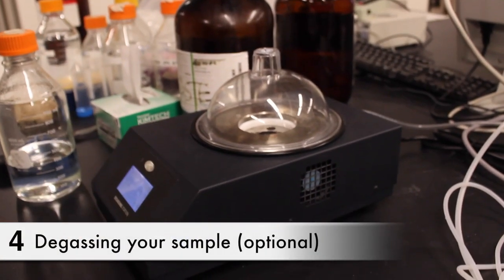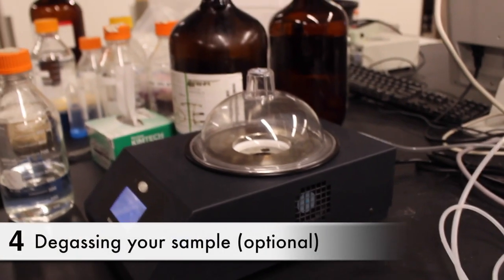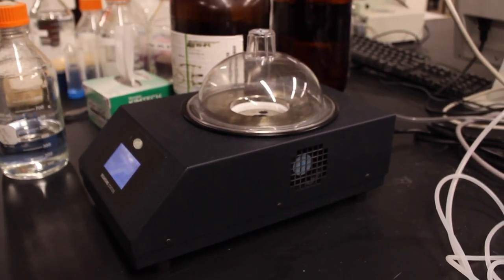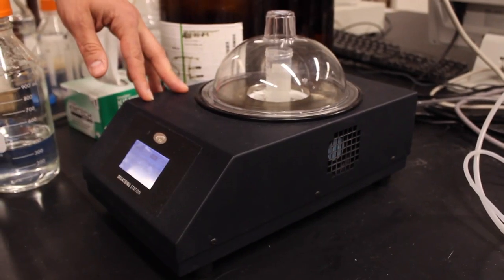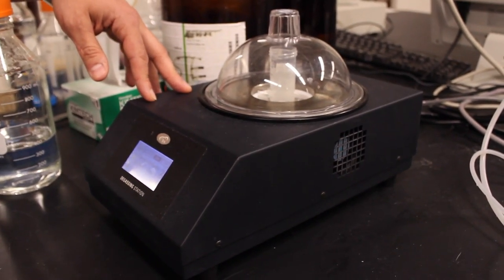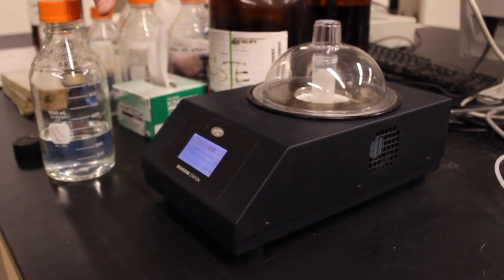As I mentioned, it's important for the syringe as well as the cell to be filled that's free of bubbles and this degassing station can help you achieve that. It's most critical typically in cases where you're running at temperatures different from room temperature.